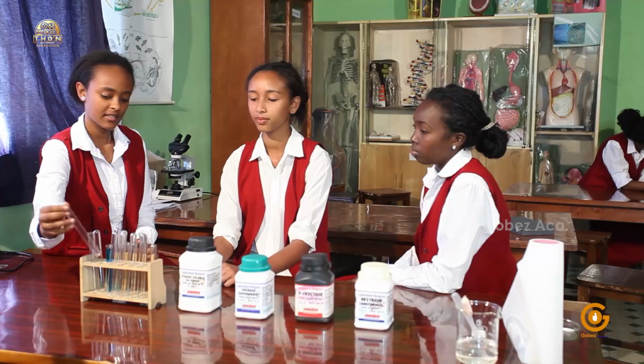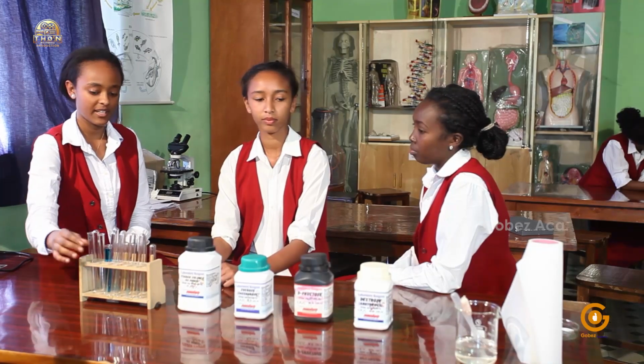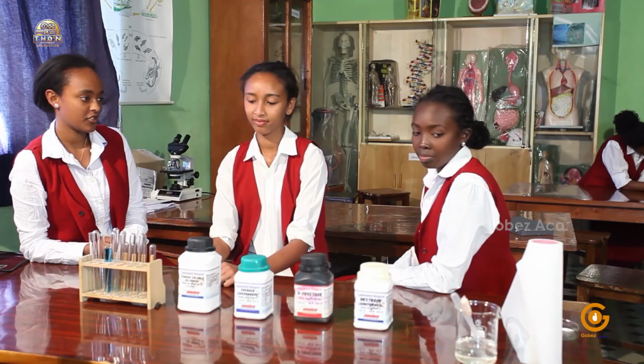Hannah, could you please bring us some distilled water so that we can add a few into the test tubes?